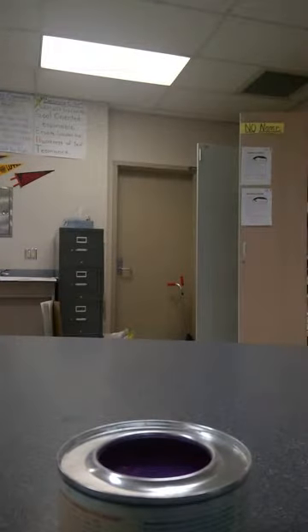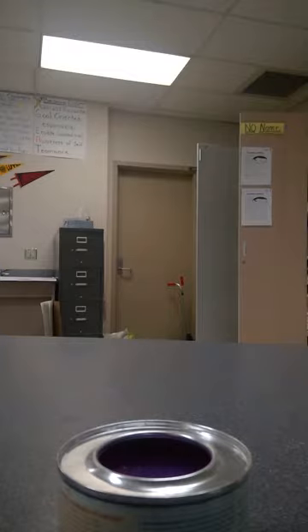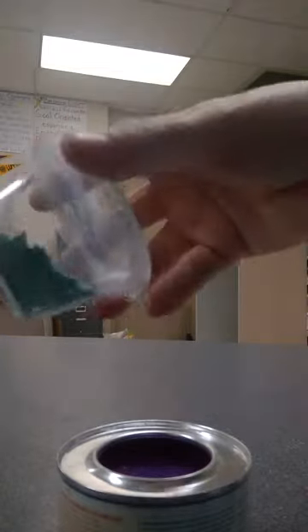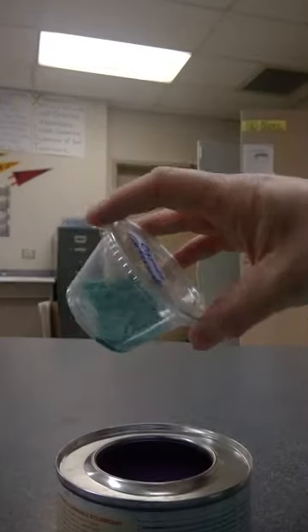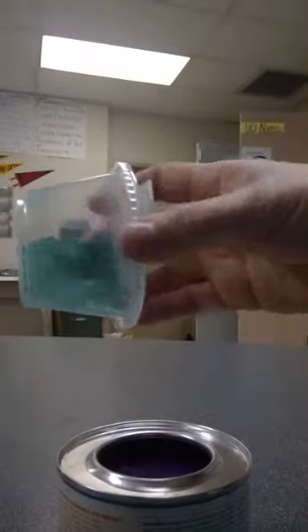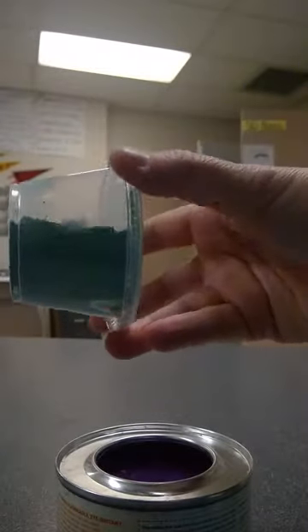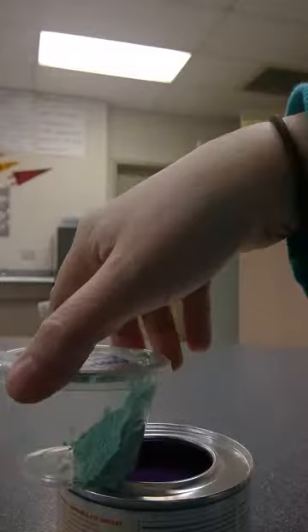Our second substance is called copper carbonate. It is green in color — a nice, almost teal green. It's also powdery.